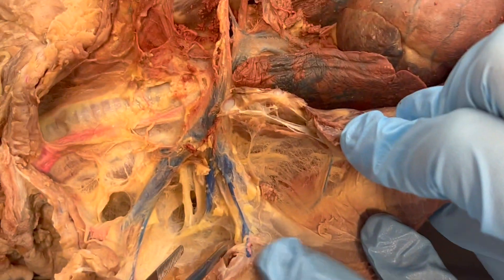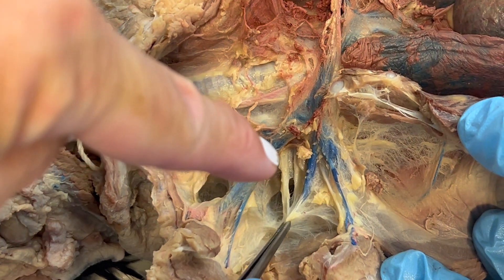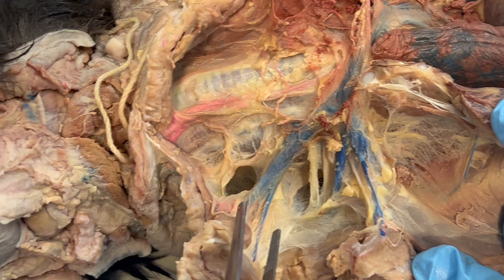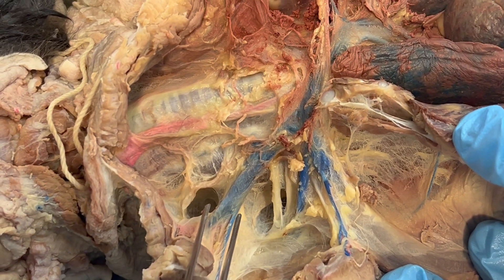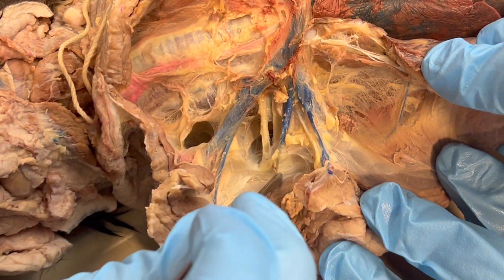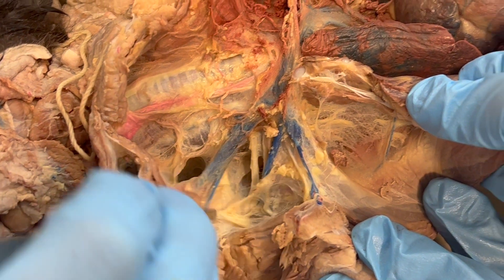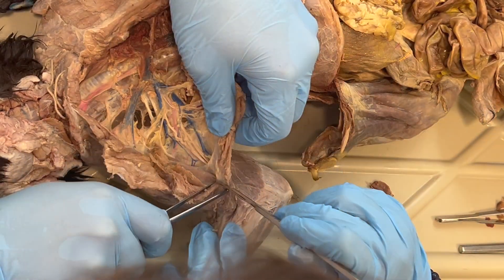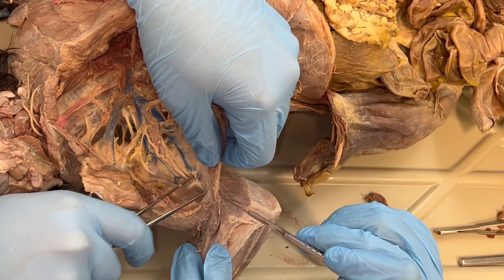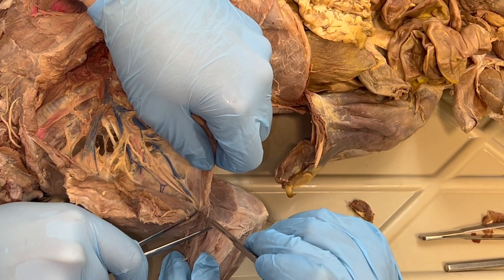This place here is actually a part that's going up towards the neck — this is going to be the external jugular. You can see that there's blue branching away a little bit there in the middle. That is a blood vessel to follow. You want to follow that along the arm and see where that branch is. Lightly use your scalpel blade to follow the blue blood vessel going into your cat's arm and try to find further branches.